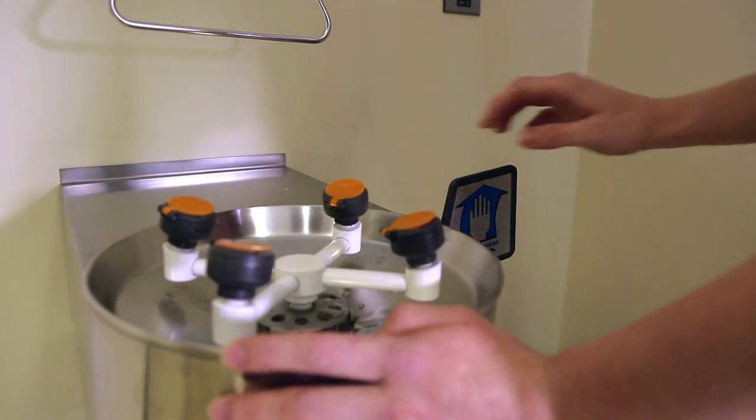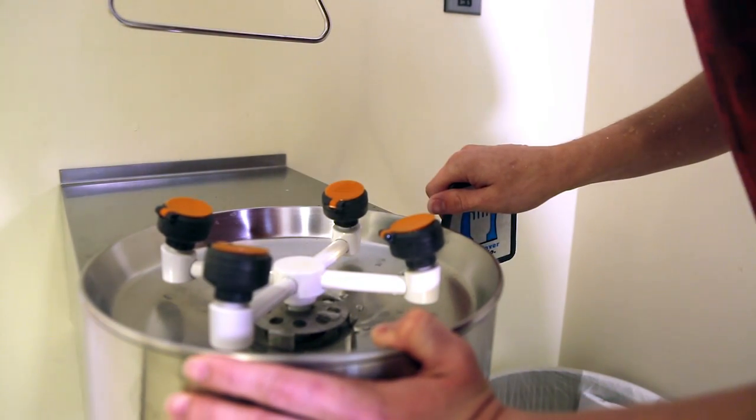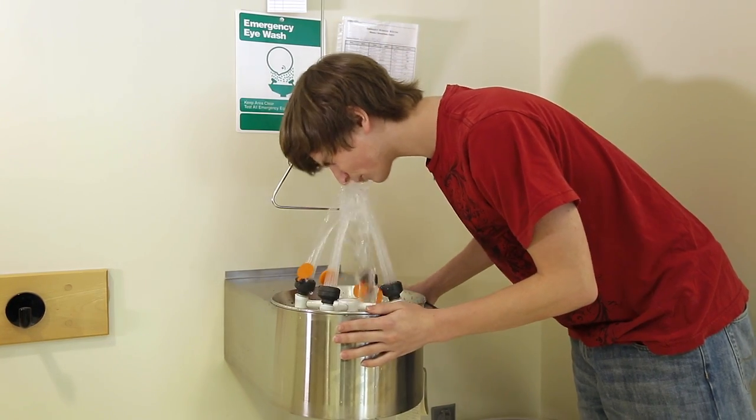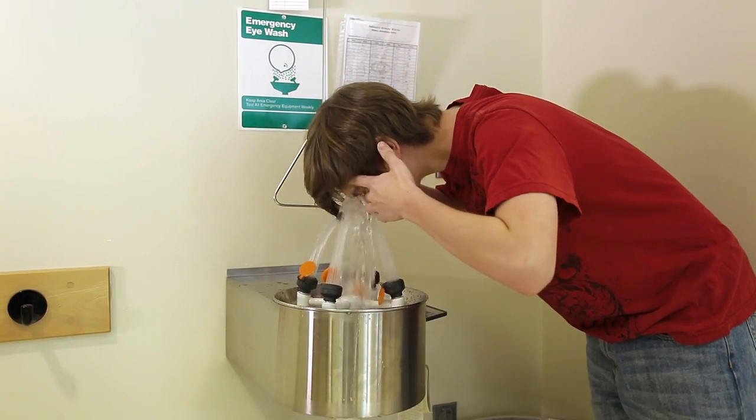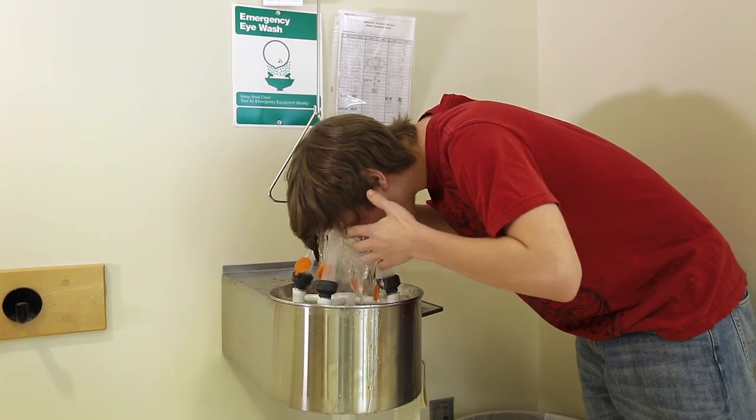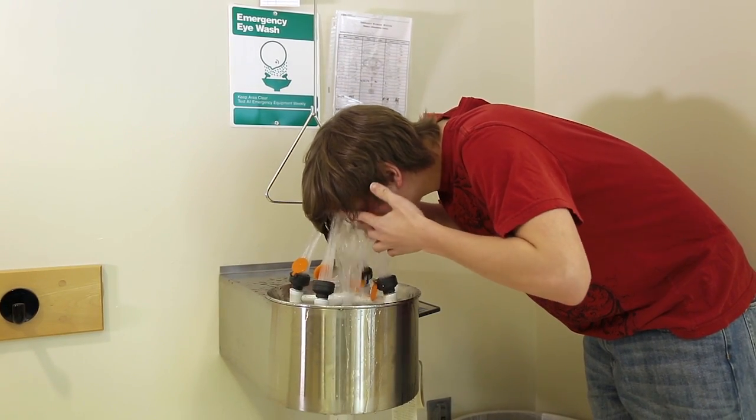The eyewash station has four sources of water so you can wash both eyes at the same time. Push the lever down until the water pressure opens the orange caps and the water flows high enough that you can put your face into the water. The eyewash station is hands-free.